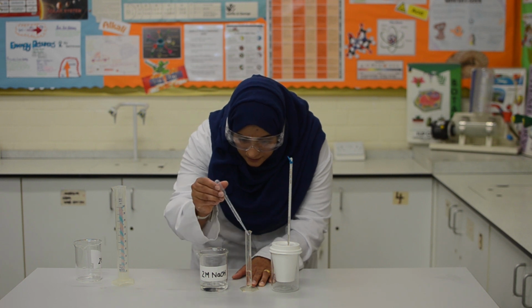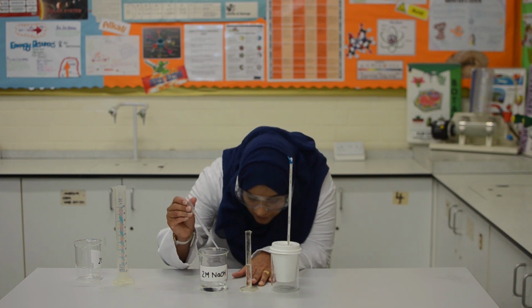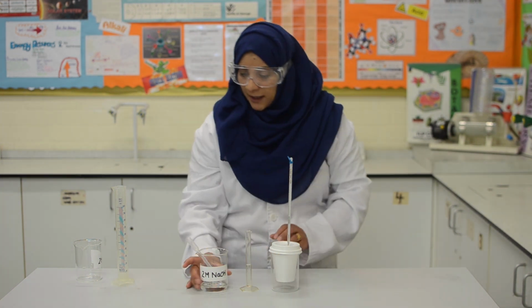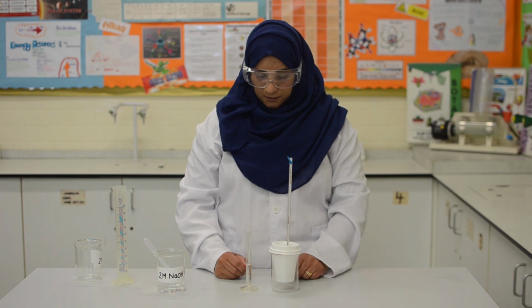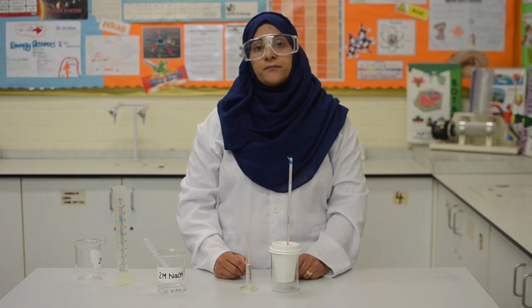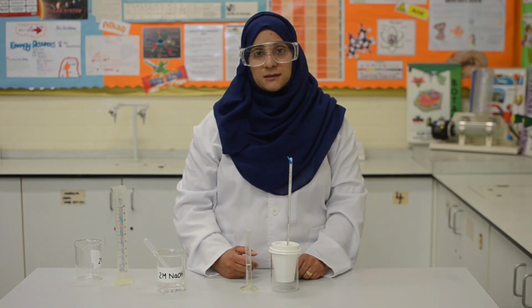Remember to read at the bottom of the meniscus. Okay, that's fine. Now, I need to add in the sodium hydroxide to the hydrochloric acid.